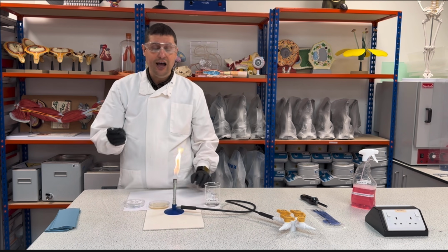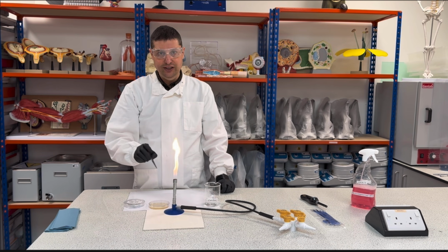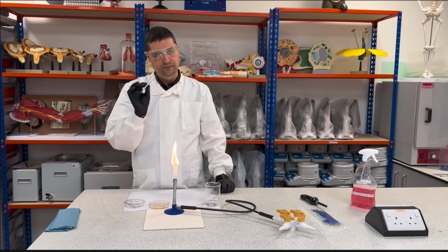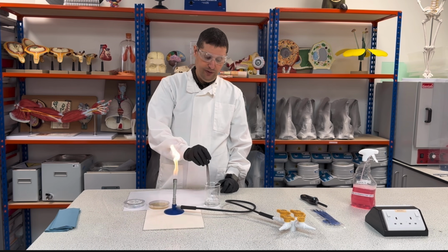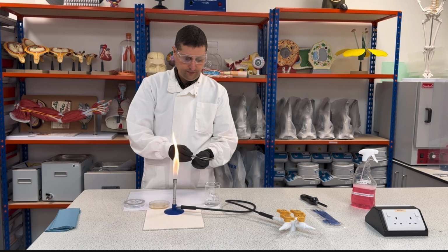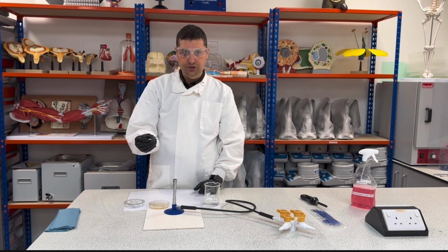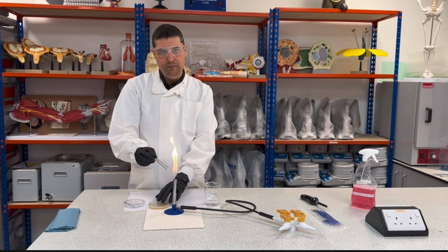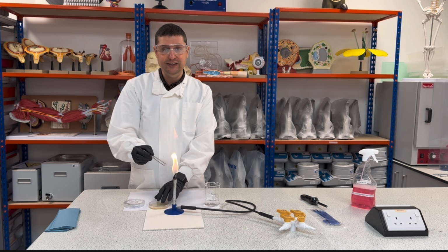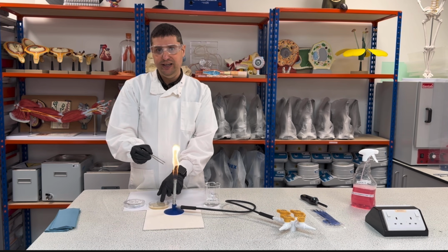and I will show you how to inoculate. Okay, because I was not putting anything in the bacteria, it's okay, right? So now I will place this in the ethanol. I will remove the excess of ethanol, and I will change my flame again. I'll change and flame this out. Okay, just to kill. Then go for orange again and keep to cool down. Then I will open the lid. At the same time, I will place my antibiotic disc facing the names up in the agar gel.